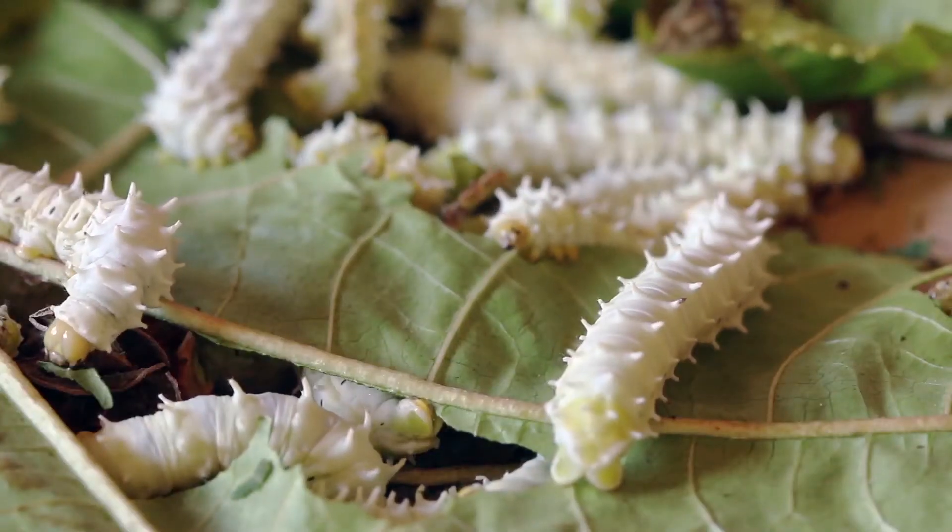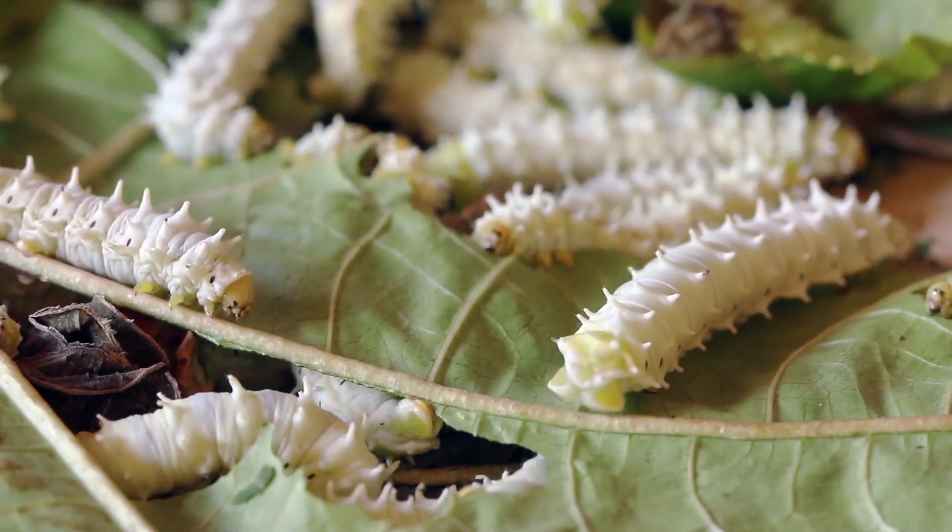I've been lucky to be involved with so many exciting science projects since my PhD. Recently, I was involved in a project to study a hydrogel made from silk and other proteins, specifically for biomedical applications such as tissue repair. Silk is the strongest material nature has made, however it's not flexible. So what we did — we took silk and combined it with another protein from insects called Resilin, which is very flexible and has very high fatigue tolerance. We combined these two proteins and made a hydrogel that has the benefits of both: it's very strong and very elastic. This material could be used in tissue engineering or as artificial muscles.